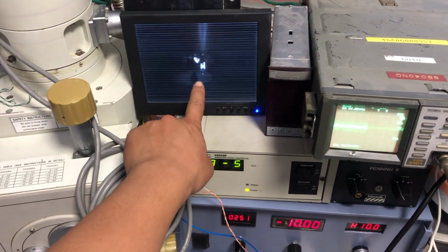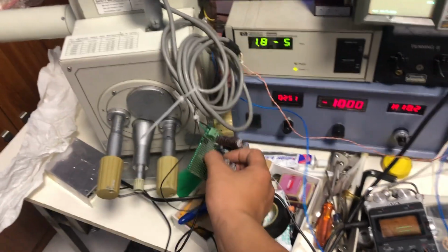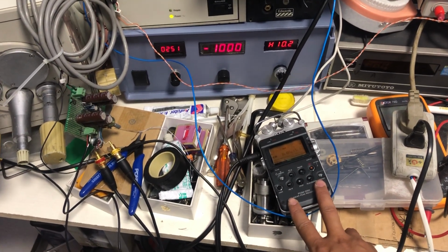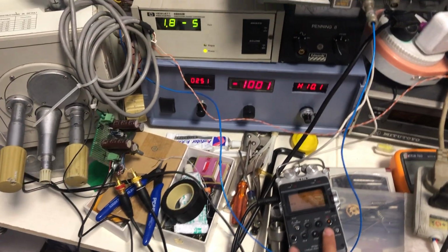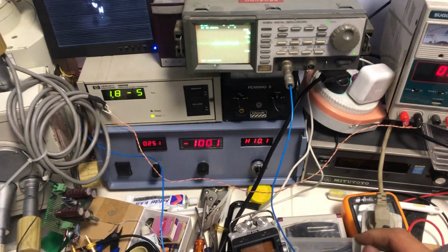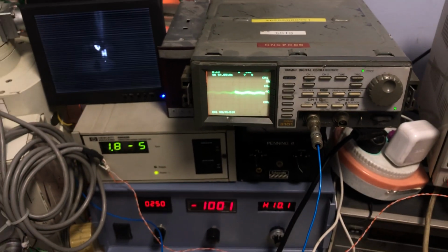You can see now there's a dot on the phosphor disk. Okay, here is the scanning amplifier. It drives the scanning coil using this PCM recorder as a signal source. So this is the focus coil that's driven by this power supply. Okay, here is the oscilloscope. Come on, focus. Display the signal.